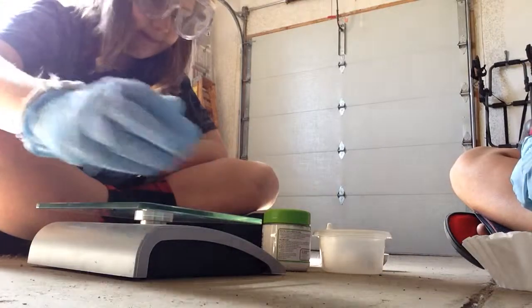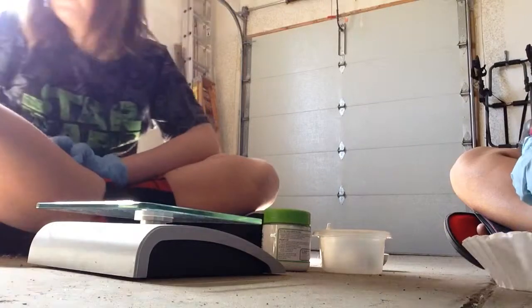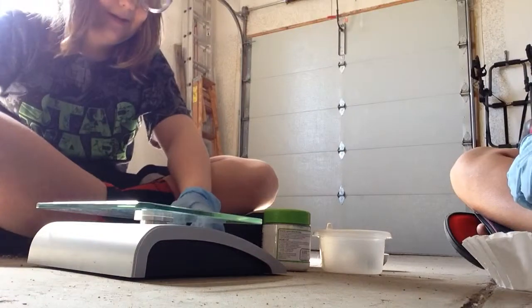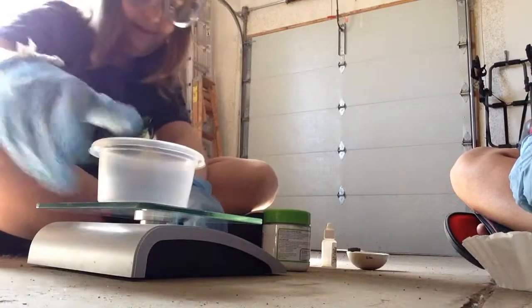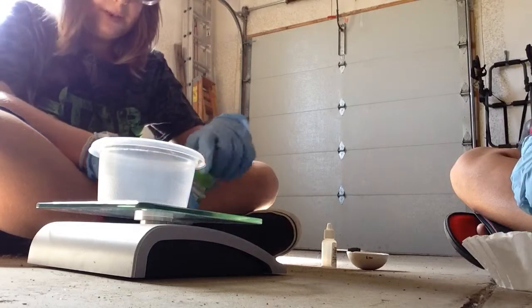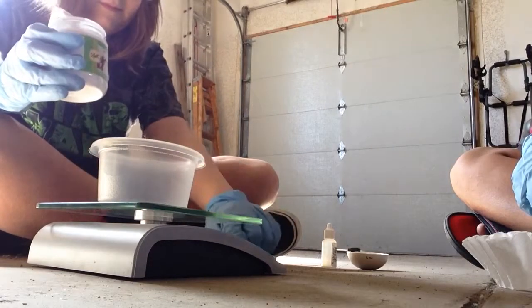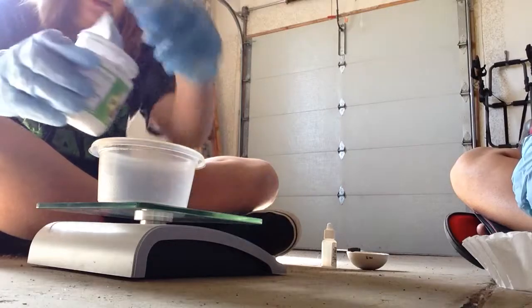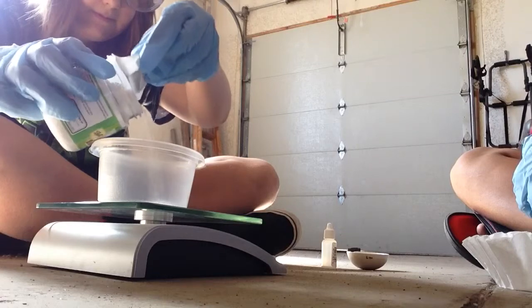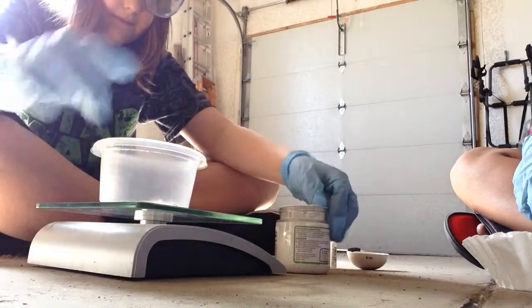You never saw how much it was. How much water, you mean? Yeah, it had four. Look — four grams. Now we're gonna zero that out, put this on there. We measure six grams of calcium chloride. That tells you how many grams? It tells you multiple things, but I'm using grams. There we go, that's six. Yeah, six.